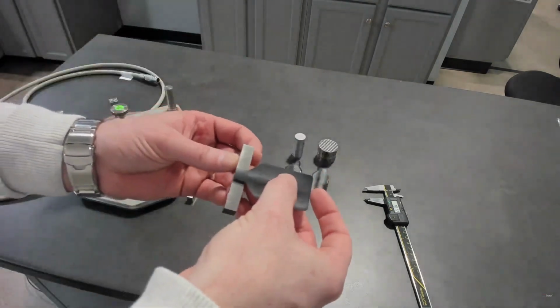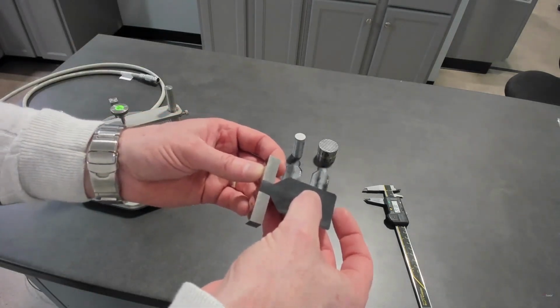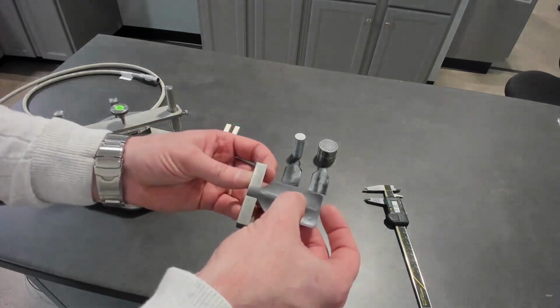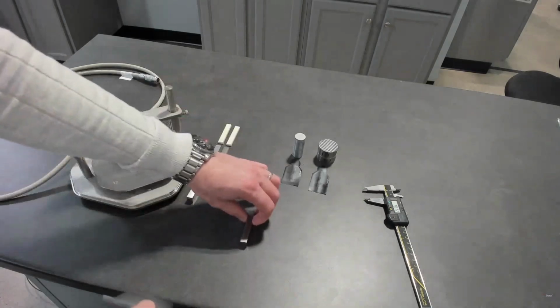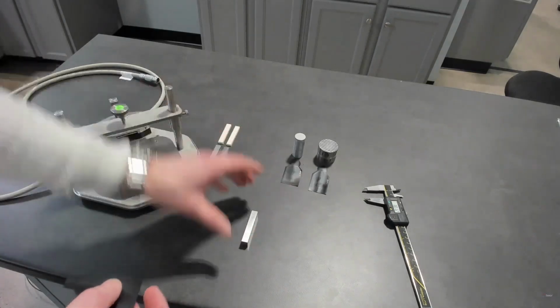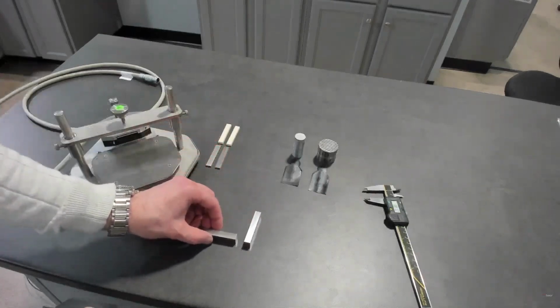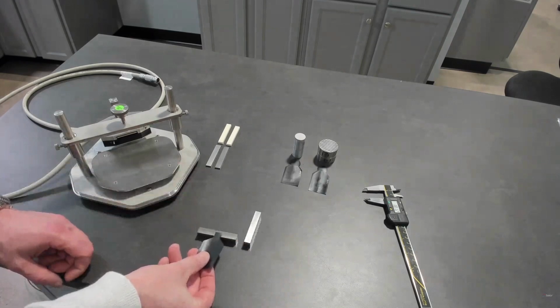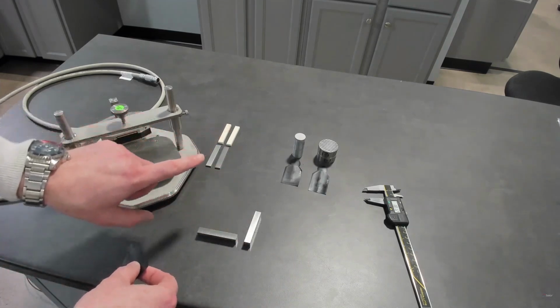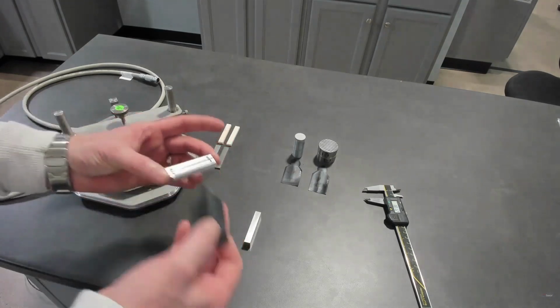So when you're using the anisotropic approach with the transient hot strip, you have the advantage of getting the two directions, but for a very specific shape. If you have a sample, a plaque, let's say, and you cut a sample from this direction and a sample from this direction, and measure each of them, you can get all three directions. That's under the principle that your sample has enough penetration depth through the thickness.